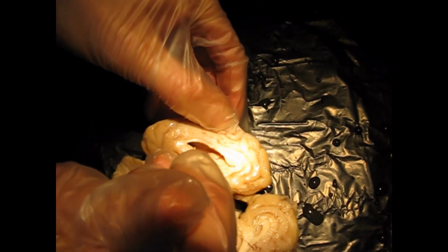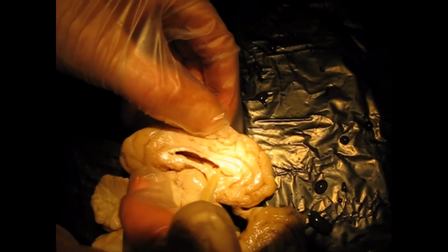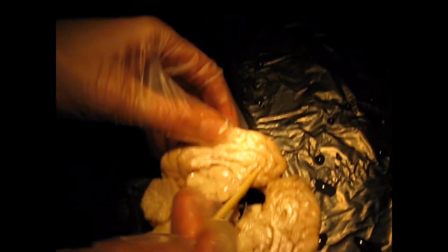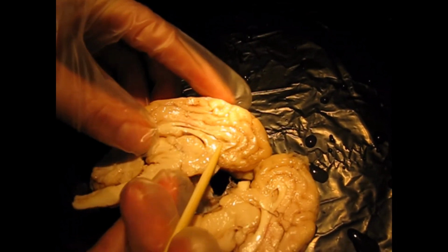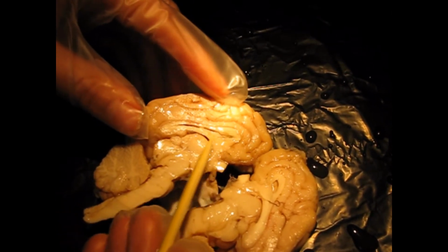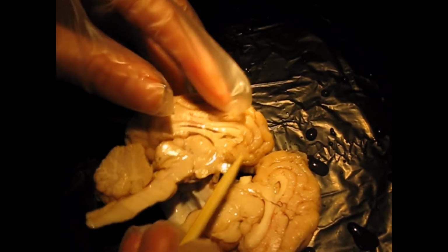You remember the 3D version, the lateral ventricle goes quite deep and is kind of like a sheep's horn in the brain. Okay, so especially once you're done with your dissection, you can really investigate that. There's a part of the ventricle that separates the right and left ventricle, the septum pellucidum. Okay, and I've just torn that away, but that just separates the right and left ventricle.